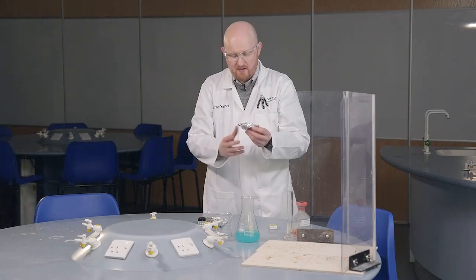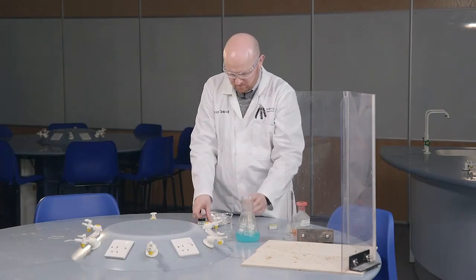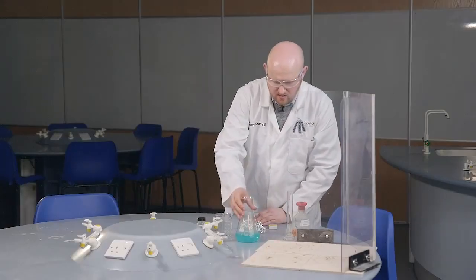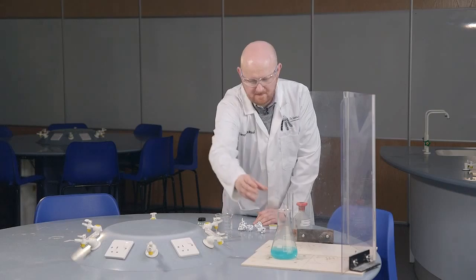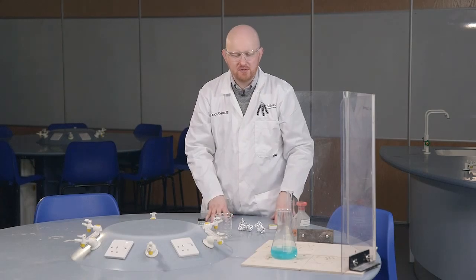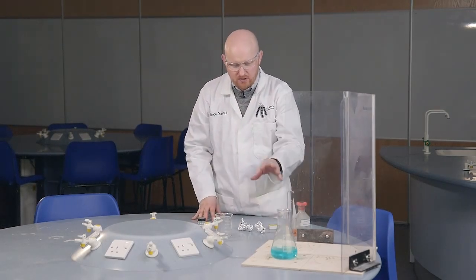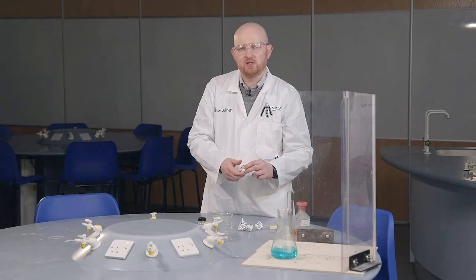Now, we have here our aluminium foil. We're going to scrunch it into little balls. Like so. And then I'm going to put my conical flask onto our heat-proof mats. Now, what we're going to do is we're going to add the aluminium balls to our conical flask. As it all reacts together, the hydrochloric acid in the solution there will just get rid of the oxide layer on our aluminium, which allows our aluminium and copper to react.